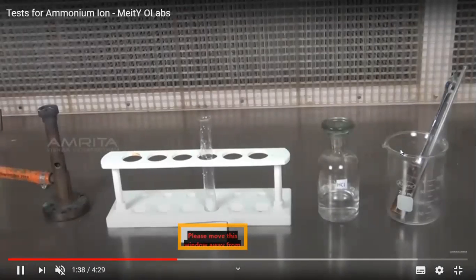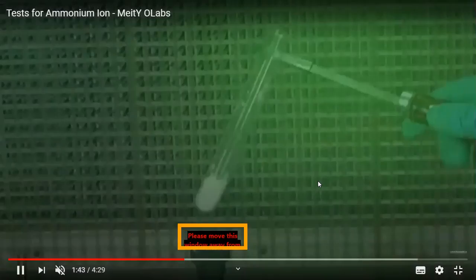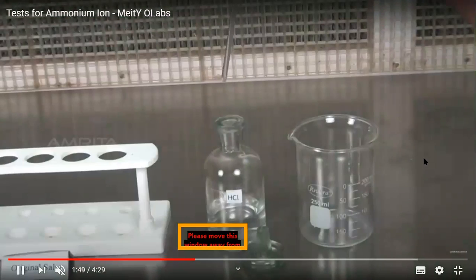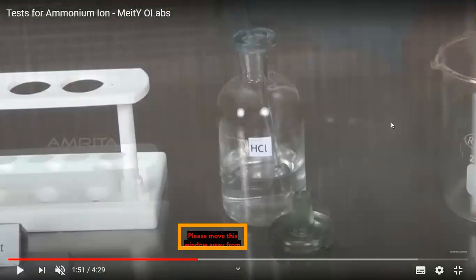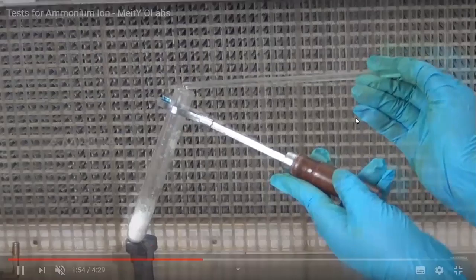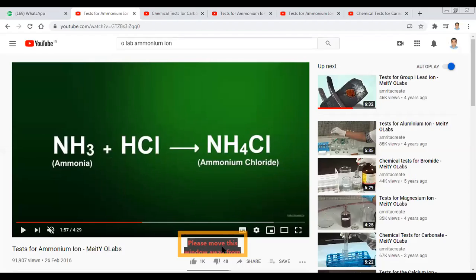We'll take our salt into the test tube and heat it on the Bunsen burner. On heating this, we get ammonia, and then we'll allow it to react with HCl. For the reaction with HCl, we'll dip a glass rod into the HCl solution and bring that rod near the mouth of the test tube. Here you can see we have brought it. You can see that there are white fumes.